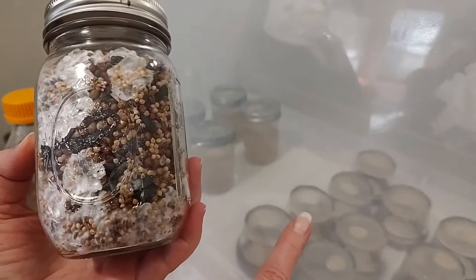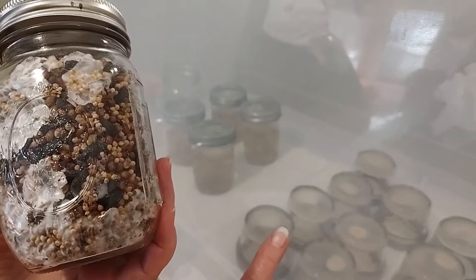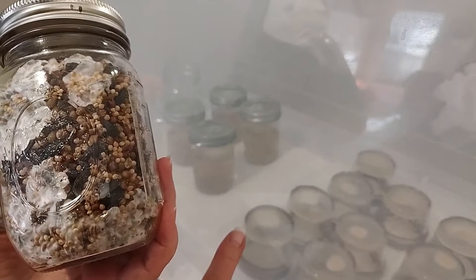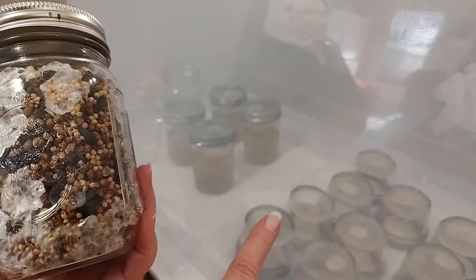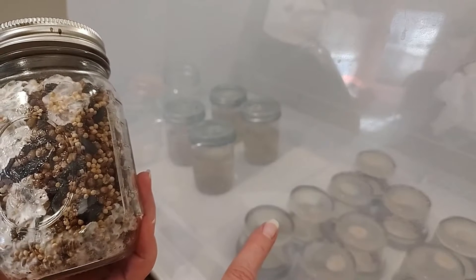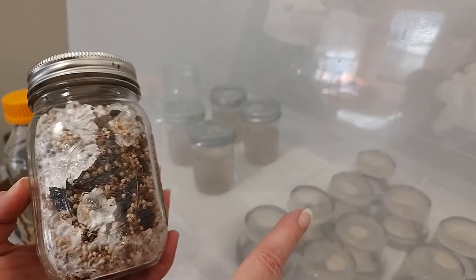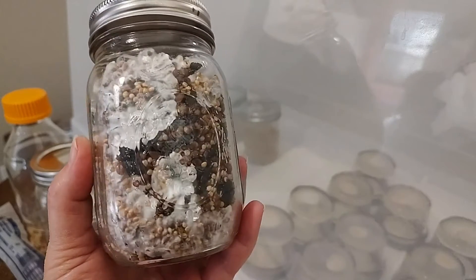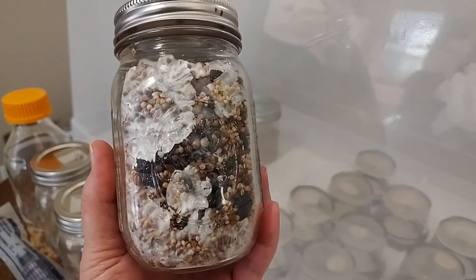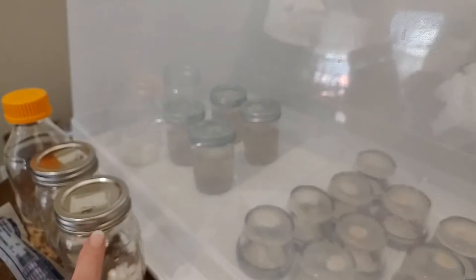When we have really beautiful plates and dishes, we use no-pour jars here. We started with petri dishes and now we use no-pour jars. You use these no-pour jars to make your liquid cultures and slurries by transferring your clones or spores you've grown out. A lot of times we have so much agar left over once we've transferred that I will put the agar straight to the bird seed. The plates were so beautiful I didn't want to waste them. You can also put spores straight to the agar, grow them out, and then put the agar into your bird seed, or make the liquid culture and slurries.